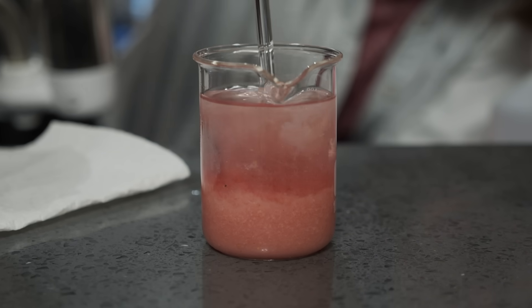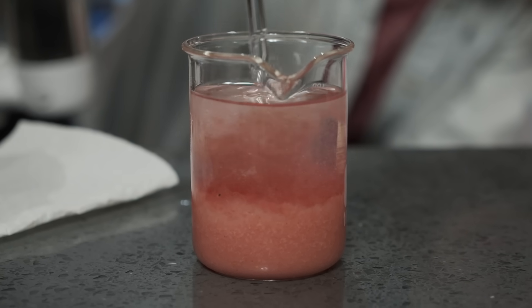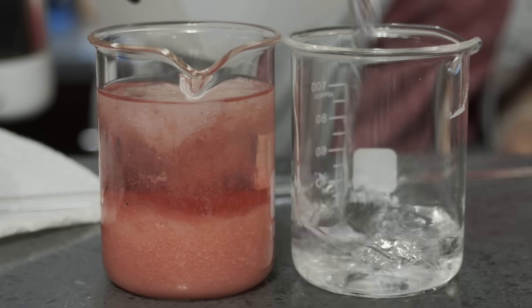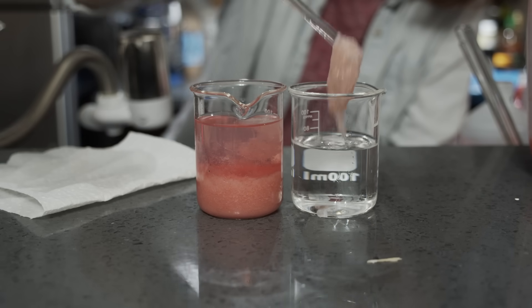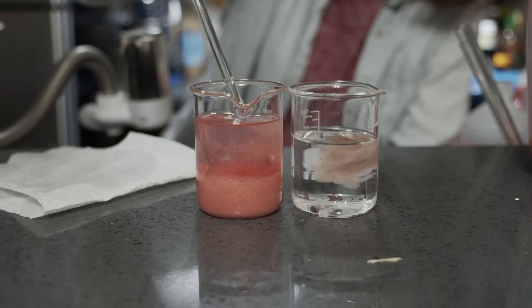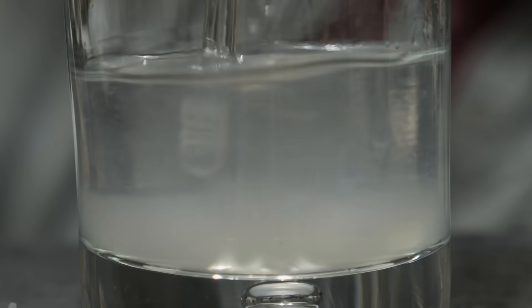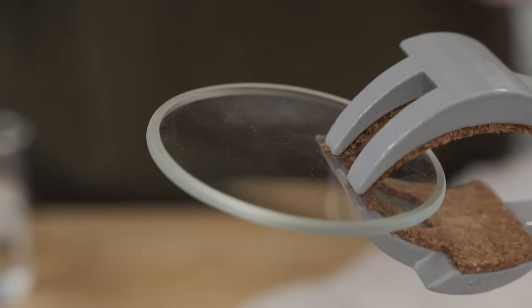Look at all this DNA — it's probably DNA plus some proteins, but look at that. Now my resulting strawberry DNA is really low purity; there is for sure a bunch of other proteins and molecules in here too. So I did try to get a really high purity DNA sample by washing it in alternating lysis buffer and isopropanol steps, which gave me a very small but probably much higher purity DNA pellet.